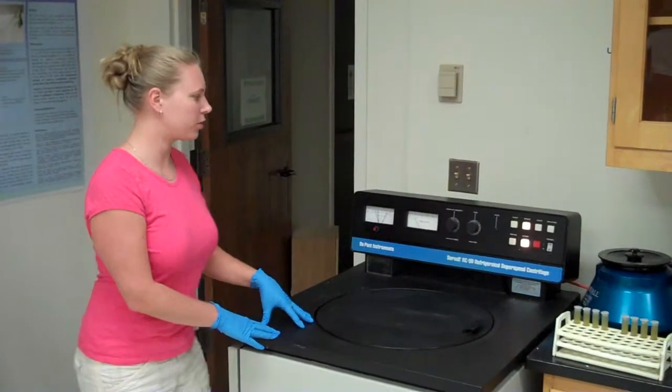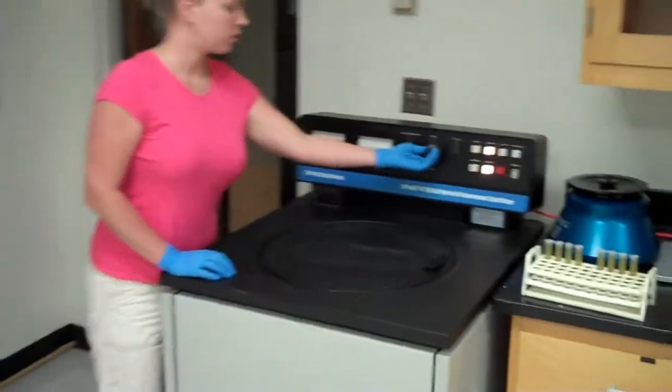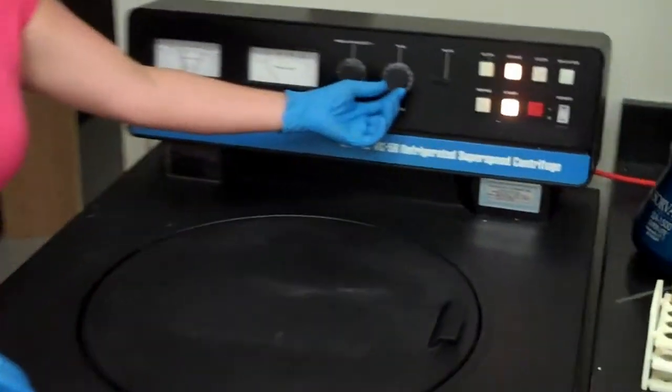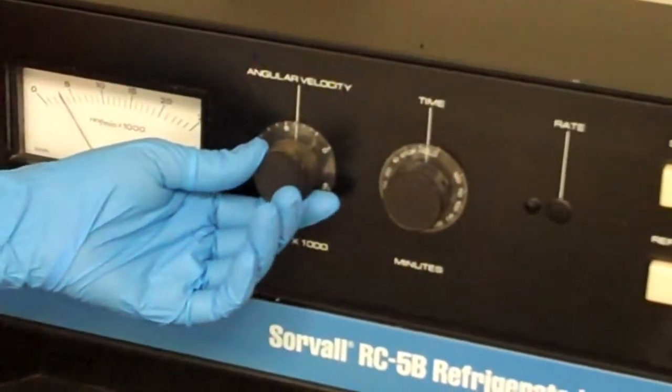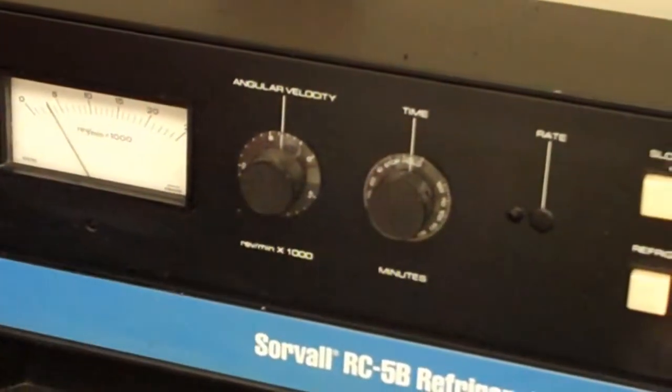Okay, in order to run this centrifuge, we need to turn the timer to hold and just set it at a small velocity and start it.